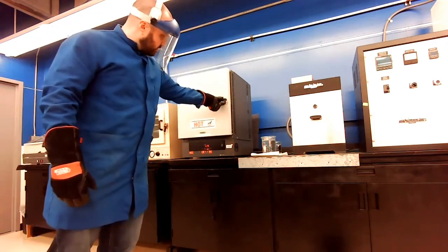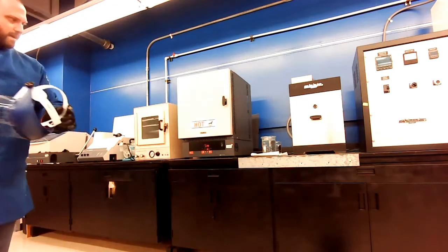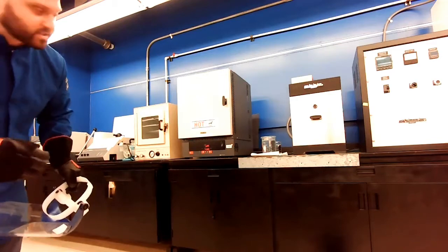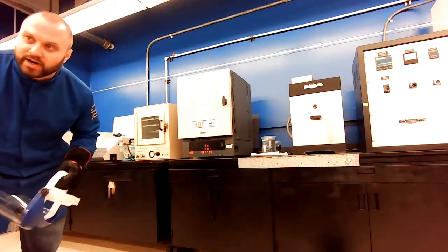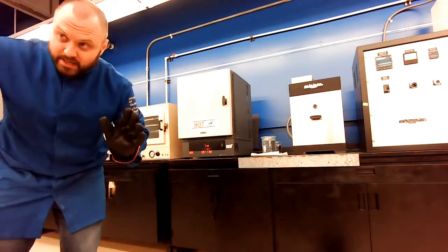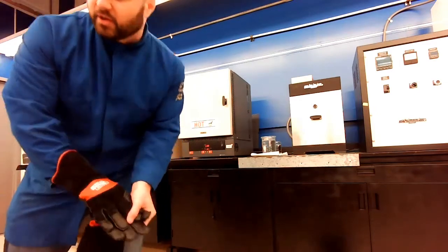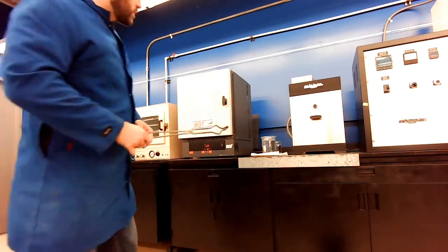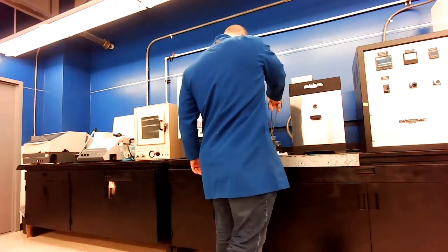So 25 degrees away, I'm going to close it back up. My guess is that this temperature is going to go up a little bit. The system's fighting itself a little bit, and then it'll come back down. We'll let it sit there and equilibrate for a little bit of time. So I'm not messing with the furnace anymore, so I can take off my face shield and my high temperature gloves. What I want to do, my last thing, is show you these samples.